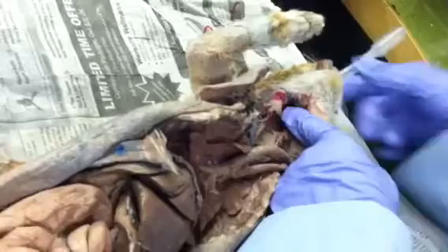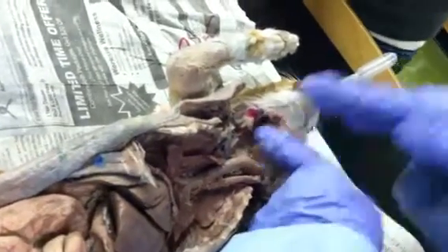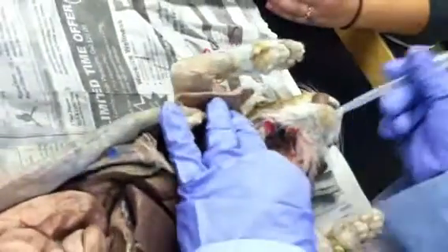Then you have the nasal cavity, and the hard and the soft palate. If I had the pipette there and you see it on both ends, the soft palate is underneath the pipette. If I had the pipette in the nasal cavity, then the soft and hard palate are over the pipette, because the soft and hard palate divide the nasal cavity and the oral cavity. So if you see both ends, you're in the oral cavity.